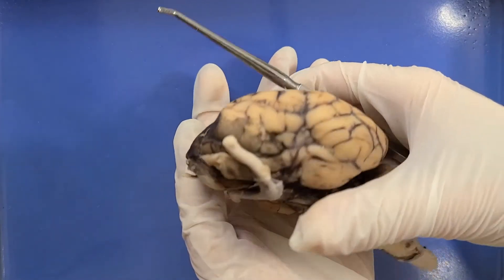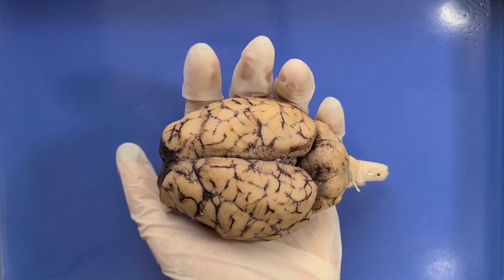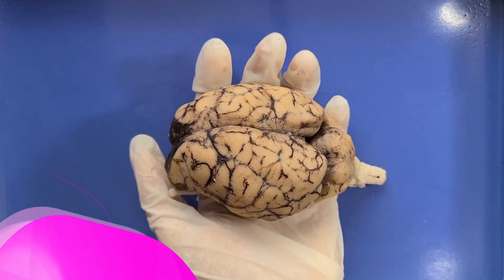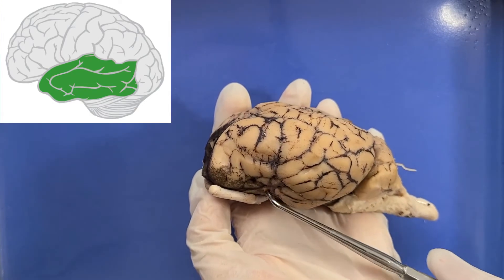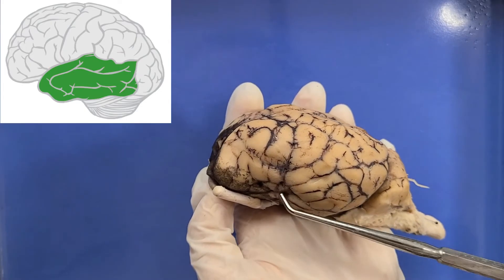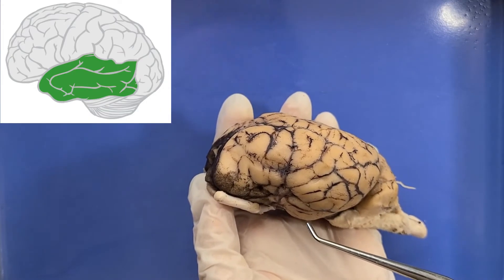Now let's look at the dorsal surface of the brain. You can see the brain has these many folds, which increase the surface area so that the brain can accommodate more neurons. The raised ridges here are called gyri, and the grooves in between are called the sulci. This here is the temporal lobe, which processes memories and integrates them with sensations of taste, sound, sight, and touch.